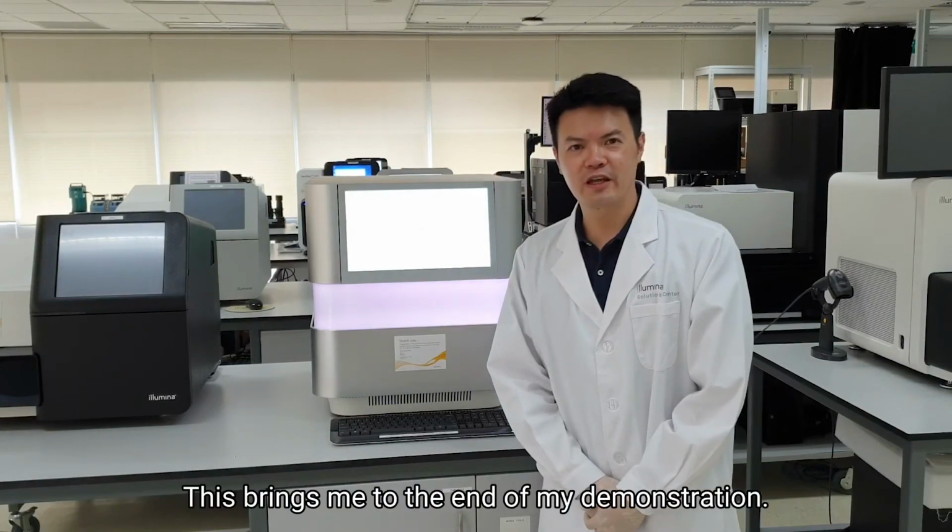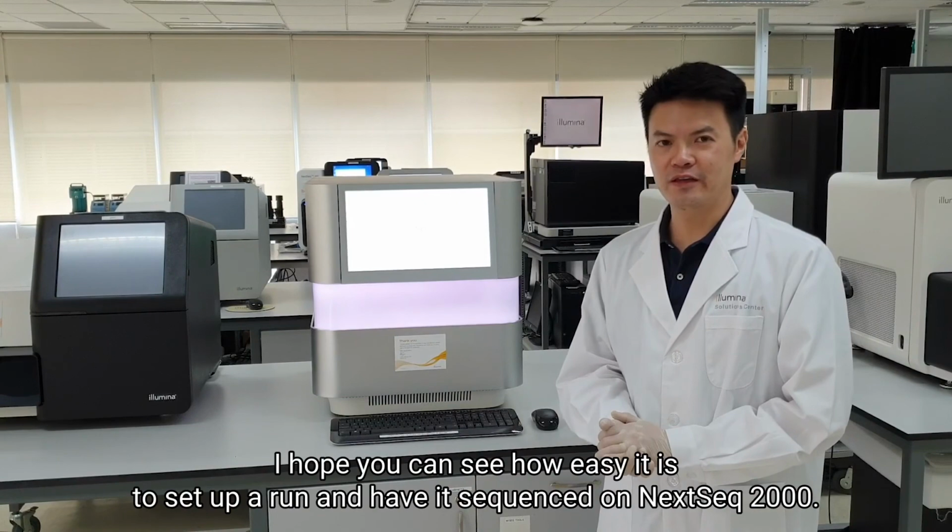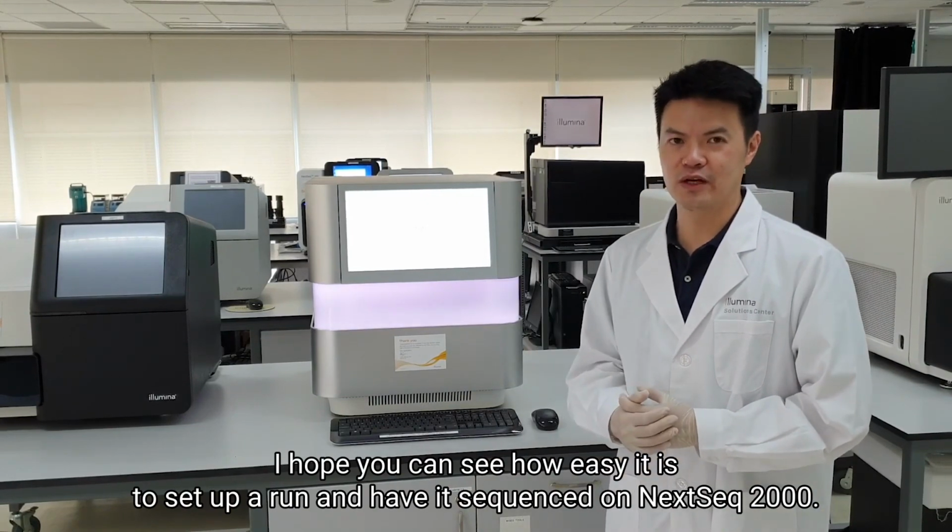This brings me to the end of my demonstration. I hope you can see how easy it is to set up a run and have it sequenced on the NextSeq 2000.